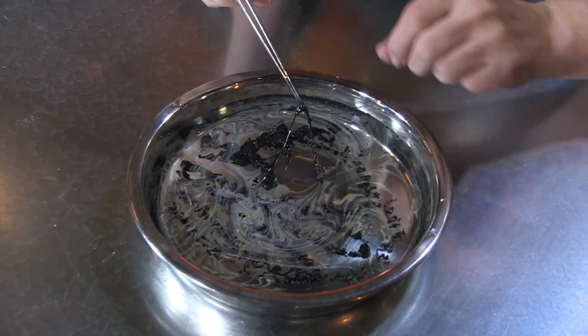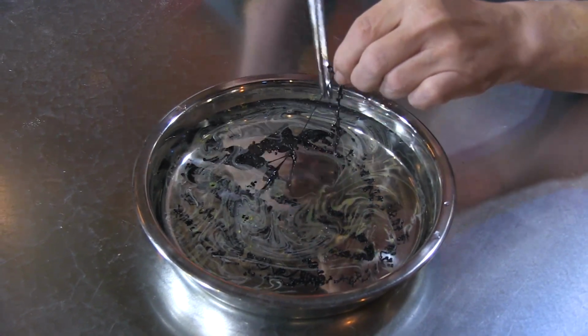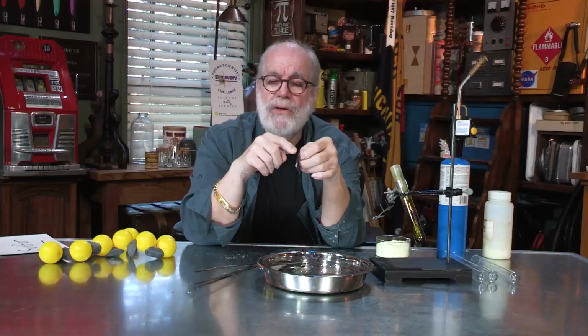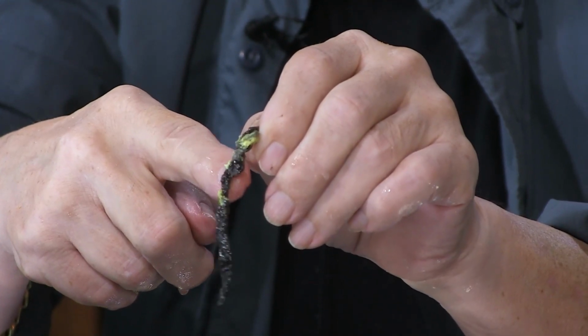Oh, baby, look at this. It's stretchy. It's like rubber now. Ooh, look at this, a nice big long booger. Now I've got hundreds of sulfur atoms hooked together in long chains. So now I can kind of roll this into any shape, make it look like a booger. I might roll it on the carpet and get a little hair in there, a crumb or 2 or something like that. You know, you hang that out your nose, people are going to have a fit.